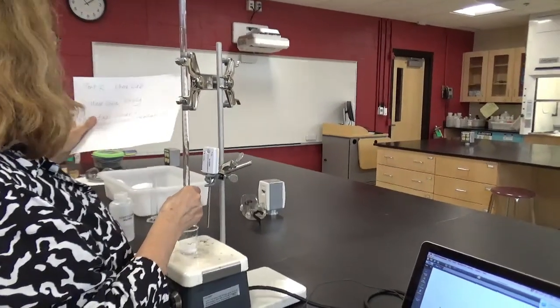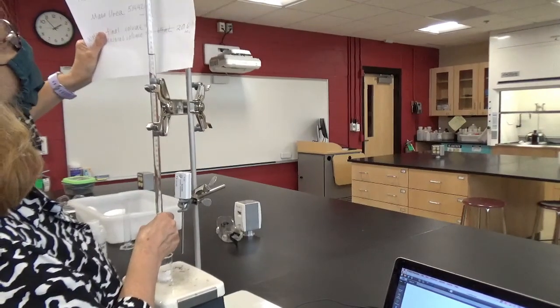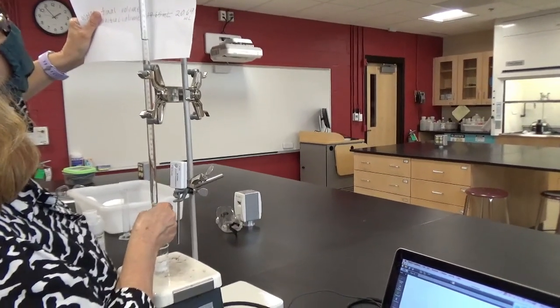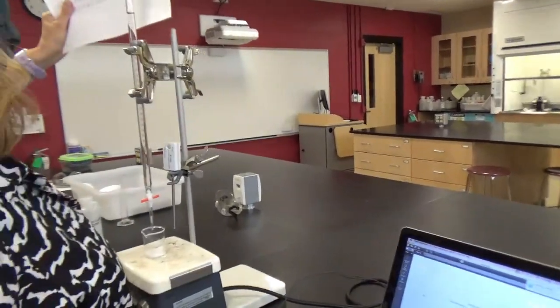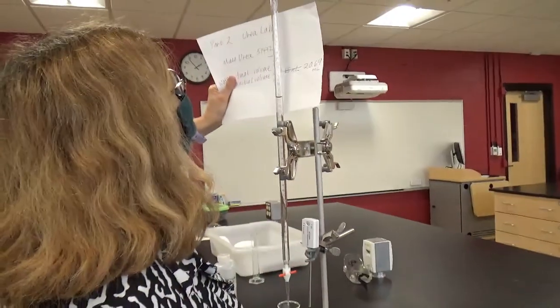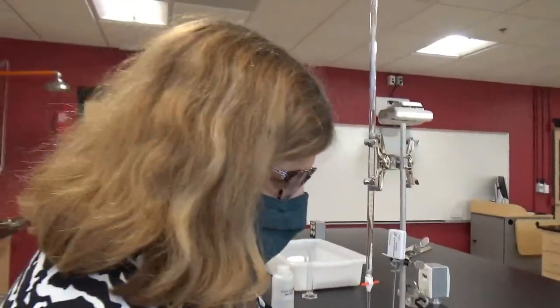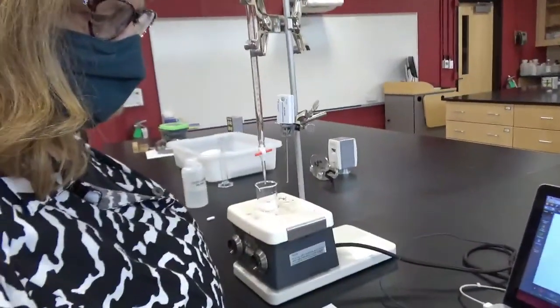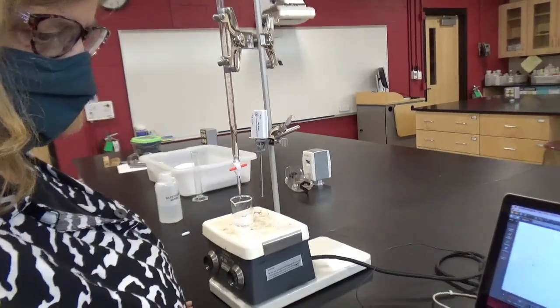Did I do that right? I'm not sure about that. Oh, well. 19.65, 22. Yeah, that's right. Except it wasn't 19.65, it was 20.69, remember? We have a lot of fun in lab correcting our mistakes.